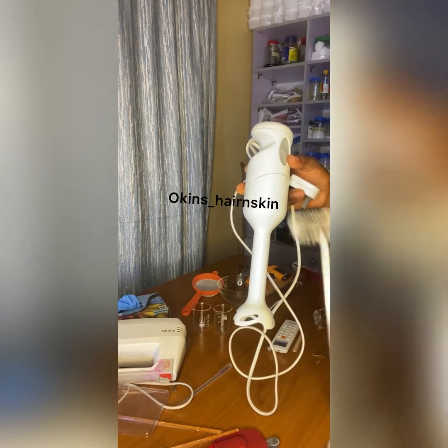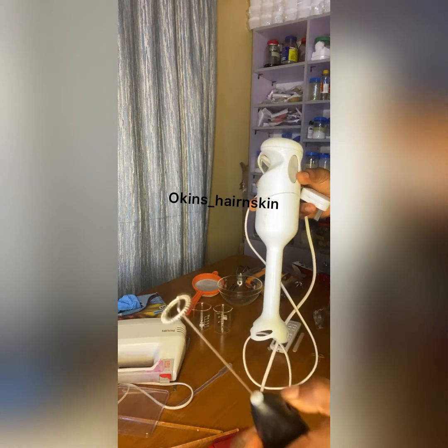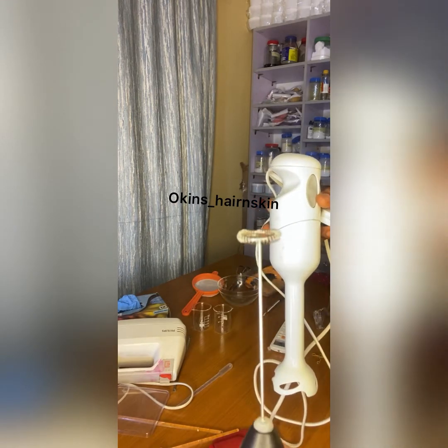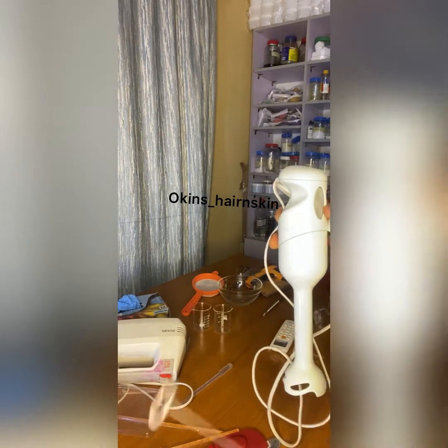Don't just look at this because it's small. It's very powerful, very powerful. You won't believe how fast and smoothly this beats. But the product has to be small. The lotion has to be small. The liquid has to be small.